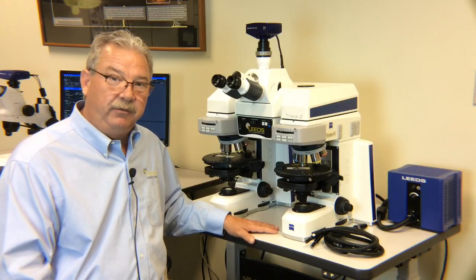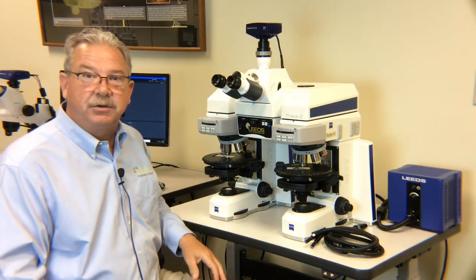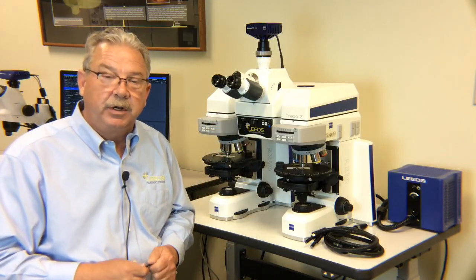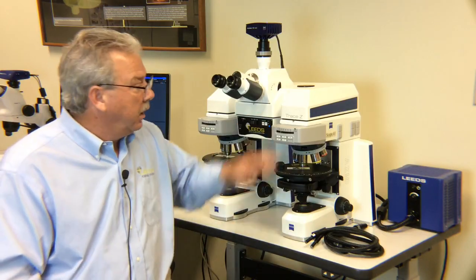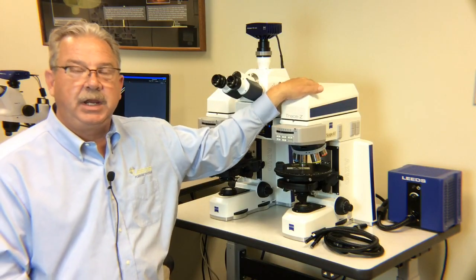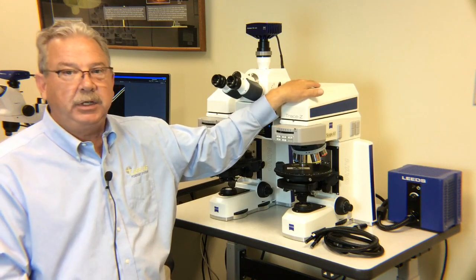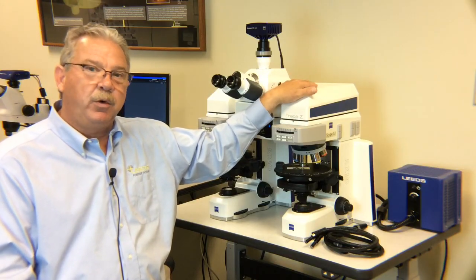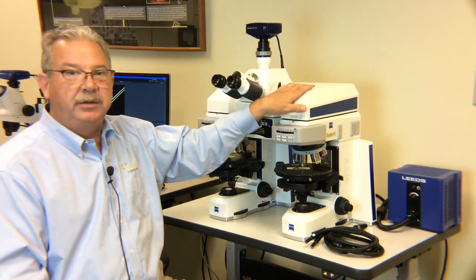A couple other quick unique features and we'll wrap this up. First and foremost, you can see I have a standard tilting Zeiss trinocular here, and that trinocular, while it tilts, which is very important to our customers, won't allow you to have simultaneous viewing to the eyepieces and to the camera port. The solution for that is Leeds builds a camera port into the trace evidence bridge. I don't happen to have one on this particular model, but by utilizing the Leeds camera port, we can simultaneously view through the eyepieces and the camera at the same time.